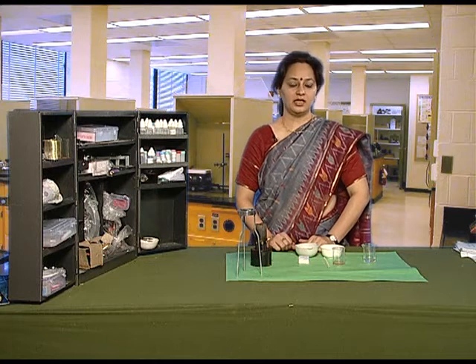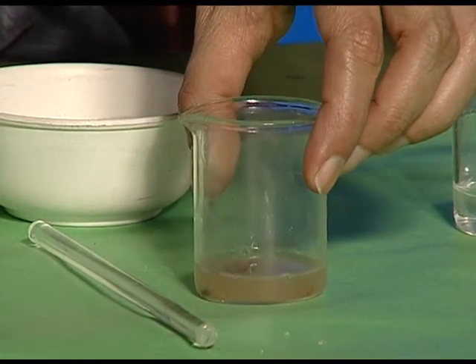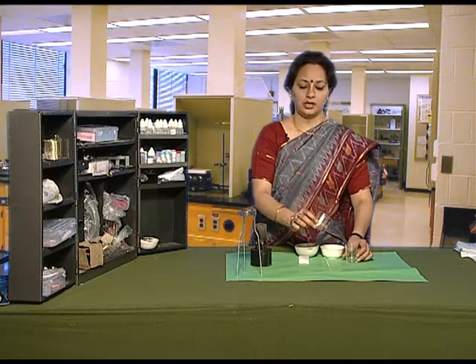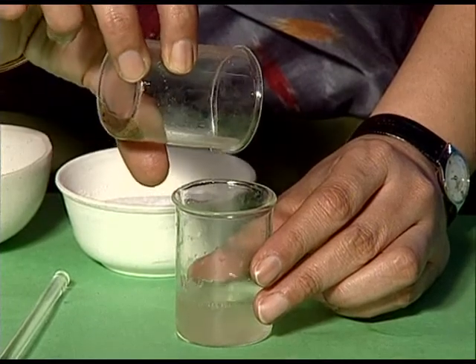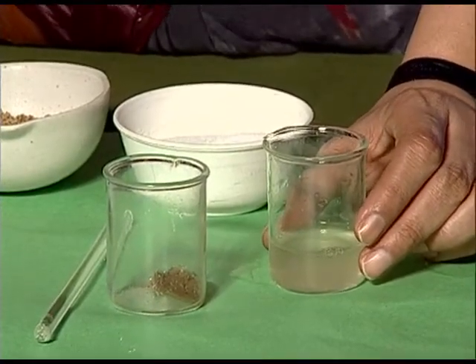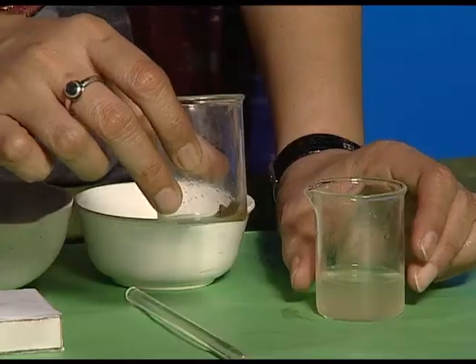After some time, we will see that sand settles down at the bottom of the beaker whereas salt dissolves in water. Take another beaker and pour the water into it. This process of separating the liquid component by pouring it into another beaker is known as decantation. In this way, the sand is separated from the salt solution.